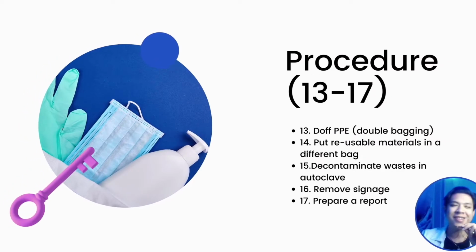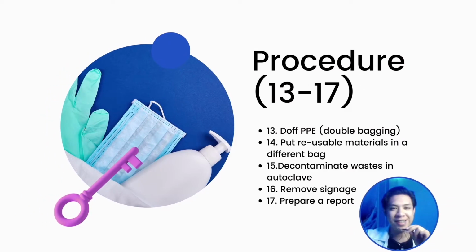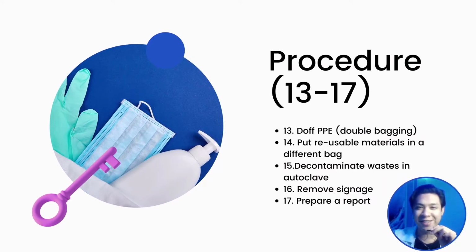We are at our final steps for a spill drill procedure. Steps 13 to 17. And again, you could pause the video if you want to take a closer look. But I just want to remind you guys that we double bag our infectious waste to avoid leaking. And we also autoclave our waste for further disinfection.